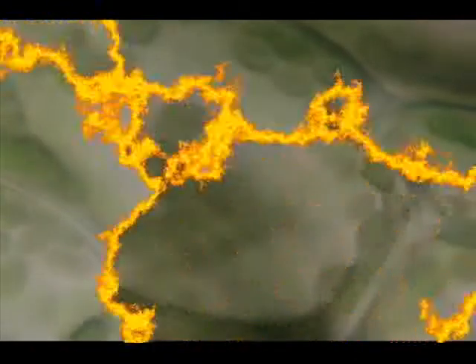The chloroplasts move in order to maximize their exposure to sunlight. Let's see if we can turn the light up on these and fire these little guys up a bit.